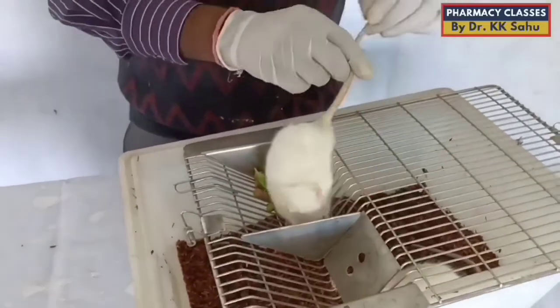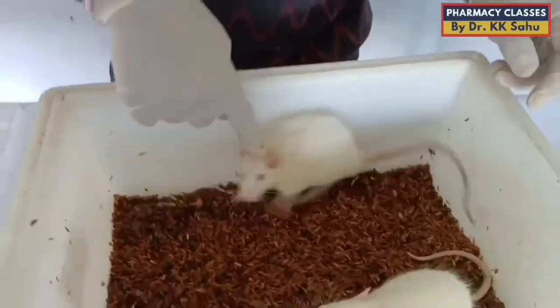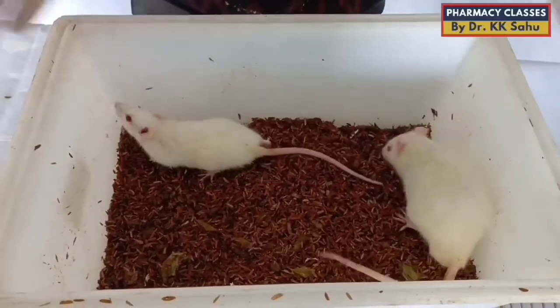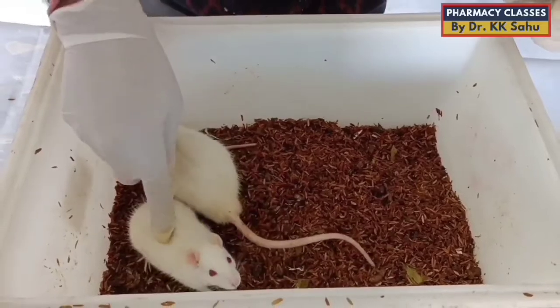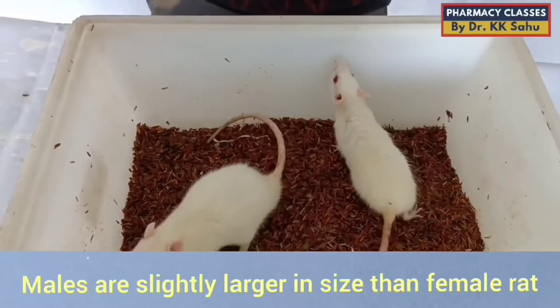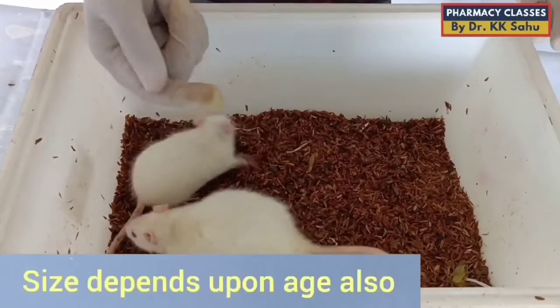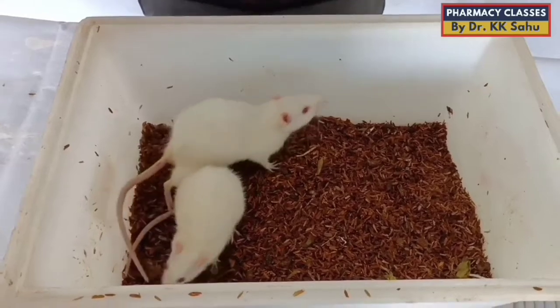The first difference between these two rats is their size. Male rats are comparatively slightly bigger than female rats. This is a Wistar rat. Sprague-Dawley rats are slightly bigger than it, and their body length is shorter than the tail length. The Wistar strain has tail length shorter than the body length. Size also depends upon age — you can't judge the sex only on the basis of size, because sometimes young males and adult females are the same size. So it is a primary level of identification, but selection on this basis only may create confusion.